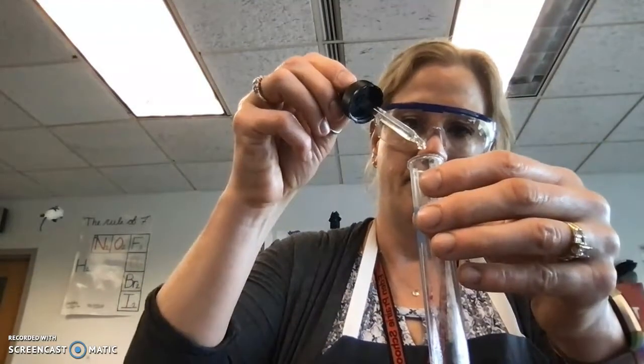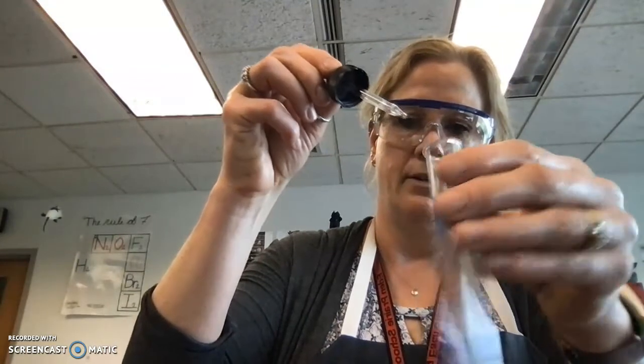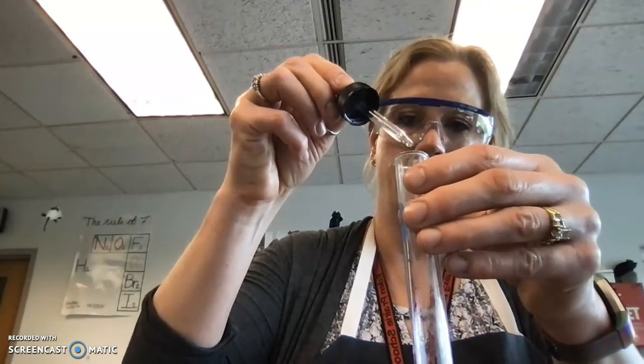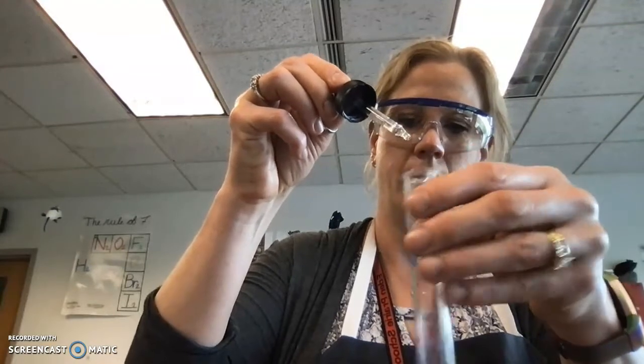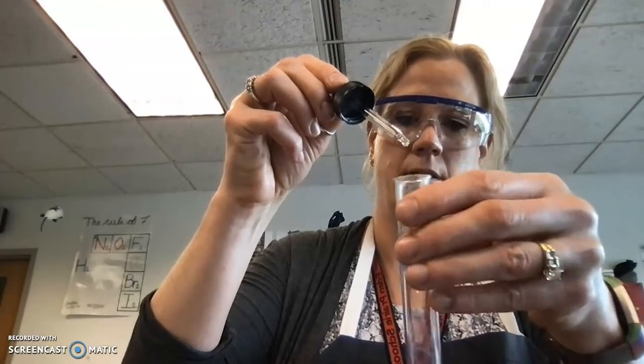Okay, I'm at 15. 20. 25, 26, 28, 28. So really close.